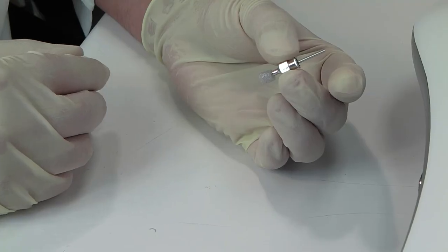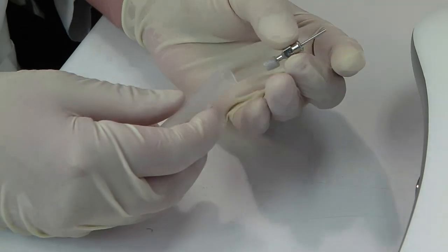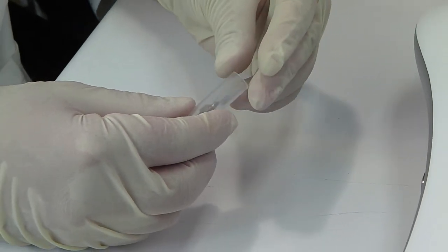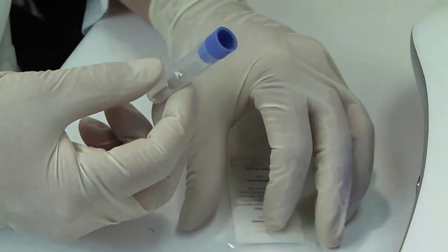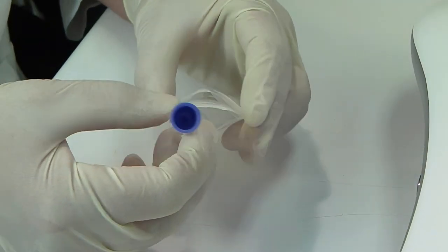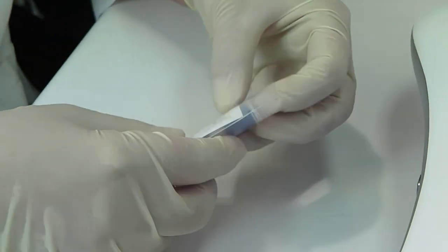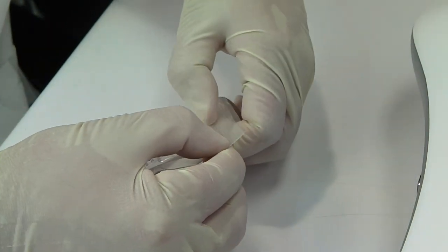The foam piece should be covering both the tip of the test probe as well as the cannula of the reference probe, and it should be holding the test probe in place relative to the reference probe. Then, gently insert the probe assembly into the container with the test probe back facing down, put the cap on, and safely store the probe assembly with its ID card.